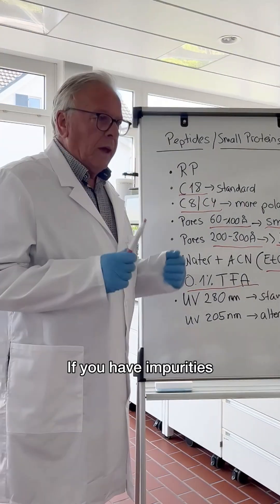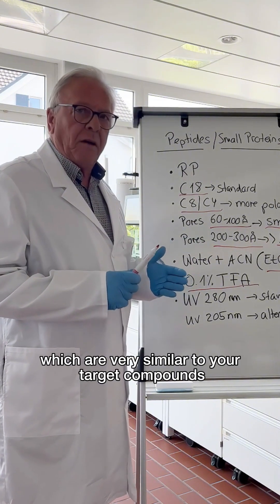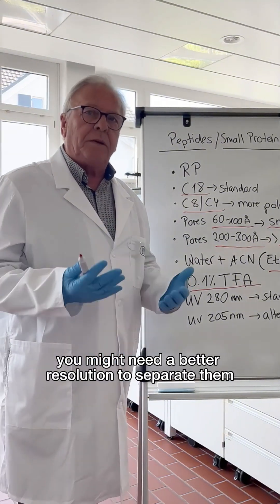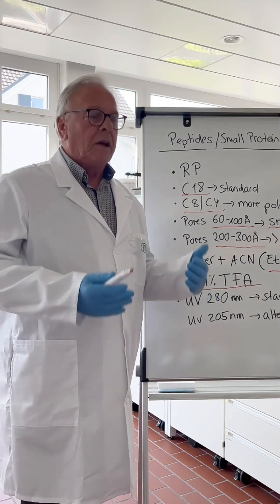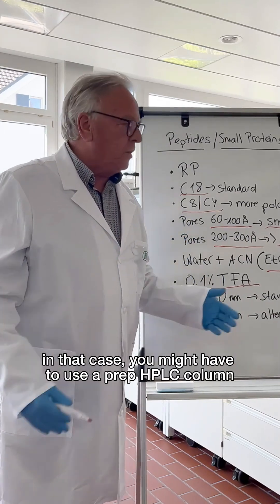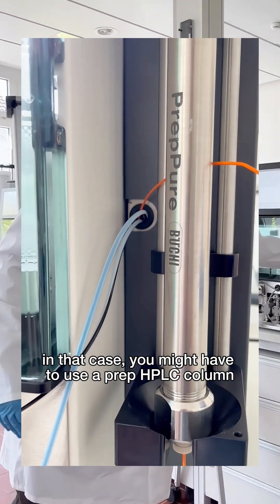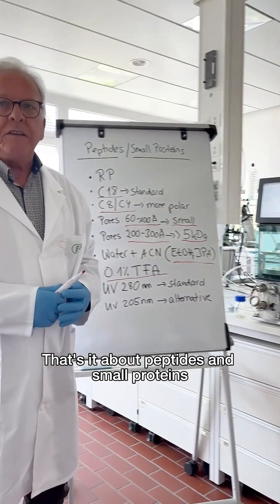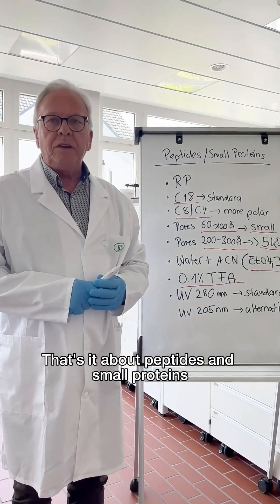I have a tip for you. If you have impurities which are very similar to your target compounds, you might need a better resolution to separate them. So go down in particle size. In that case you might have to use a Prep HPLC column. That's it about peptides and small proteins.